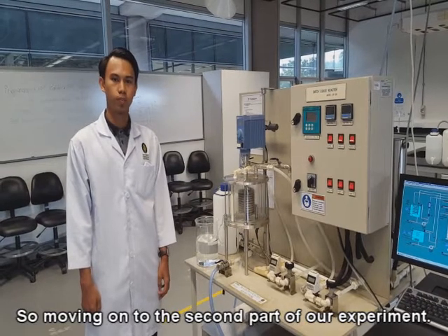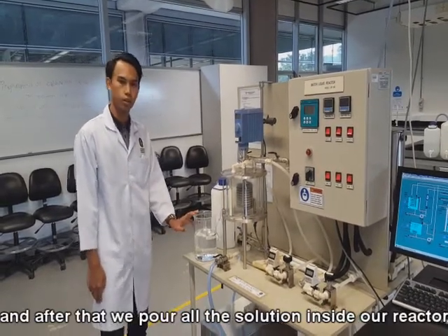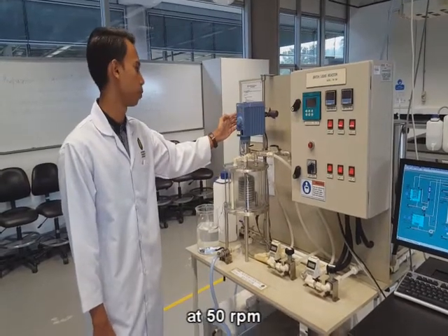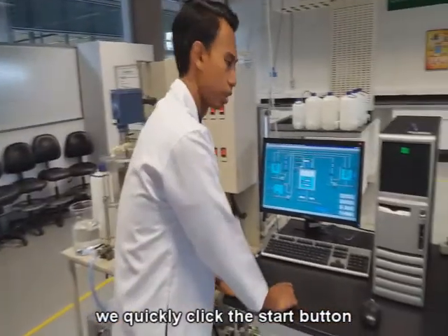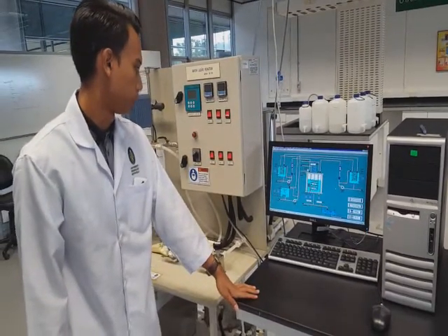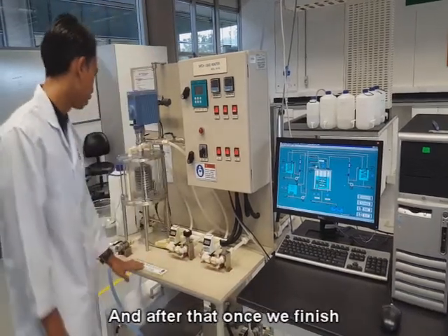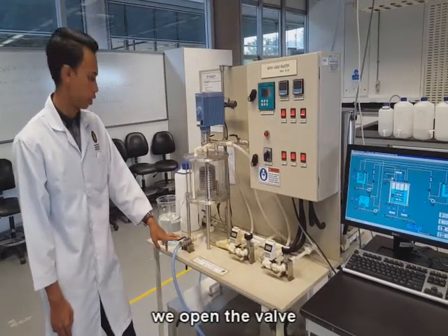So moving on to the second part of our experiment. First, we prepare the solution, and after that, we pour all the solution inside our reactor, and then we set the stirrer speed at 50 RPM. Once we start the stirrer, we quickly click the start button in our DAS system in order for the system to collect our conductivity data, which is at 1 minute interval for 30 minutes period.